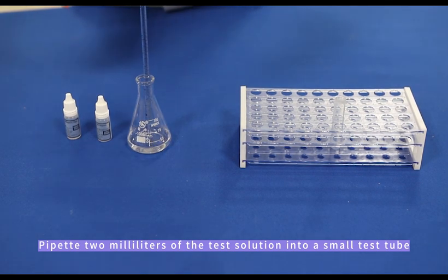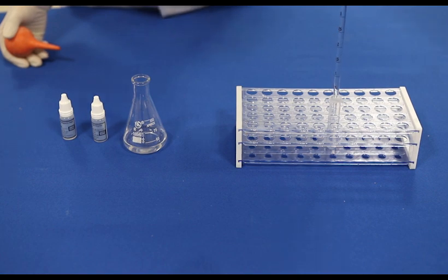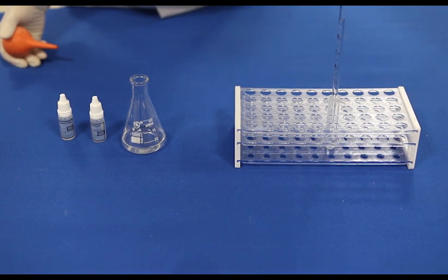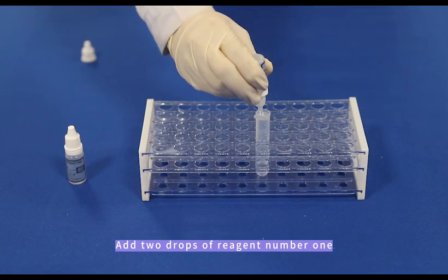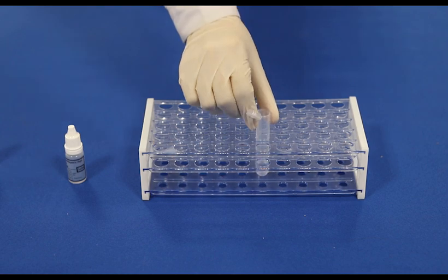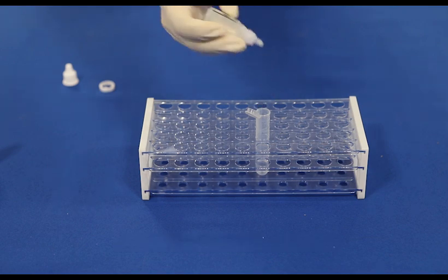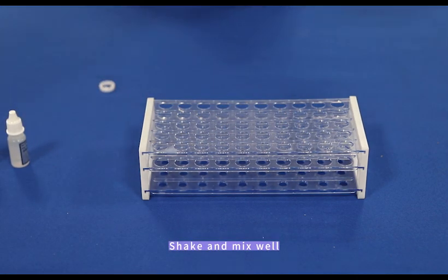Pipette 2ml of the test solution into a small test tube. Add 2 drops of reagent number 1, then add 4 drops of reagent number 2. Shake and mix well.